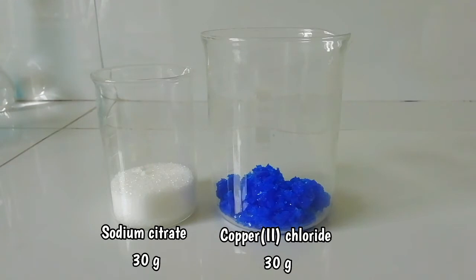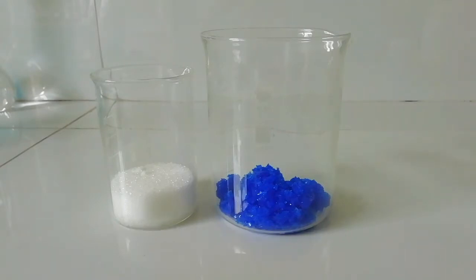If you don't have copper chloride, you can also use copper sulfate. You have to calculate the stoichiometry and get the correct stoichiometric amounts of both chemicals for the reaction. This is important.